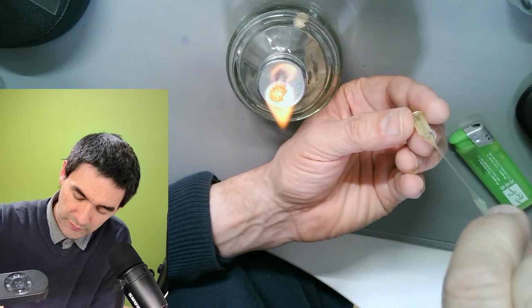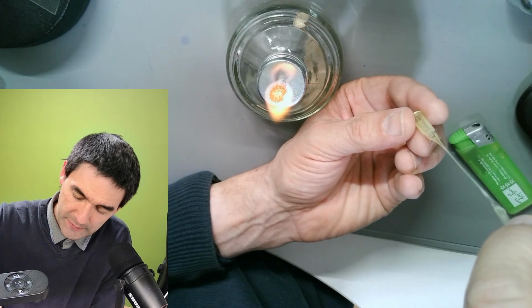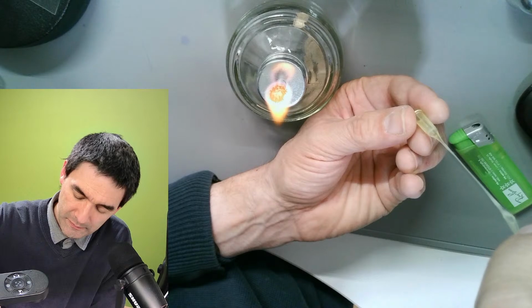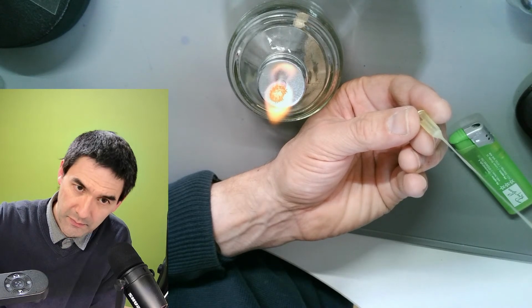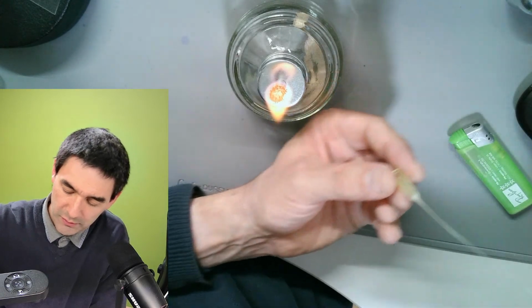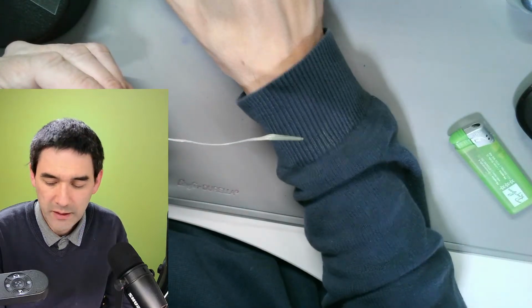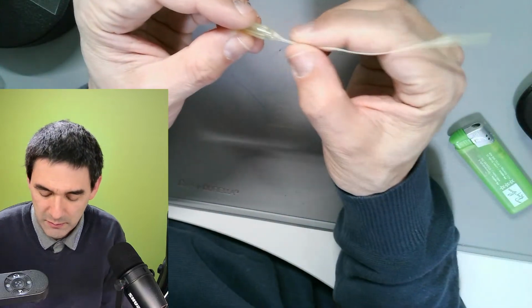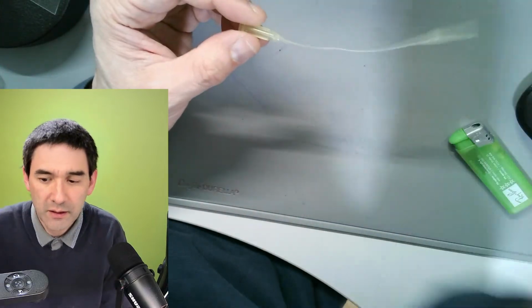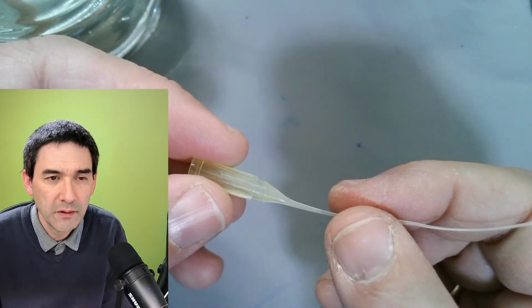Actually, it worked. First trial. And then you hold it like this. And finished. Okay. Let's move it a little bit away here. I'm going to put it up here. See? And we're actually already finished with that. Okay. Yeah. Here, this is how it looks like.